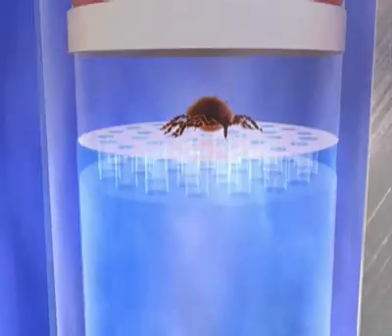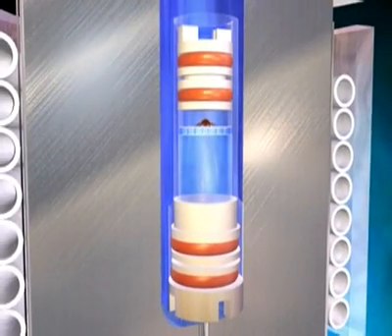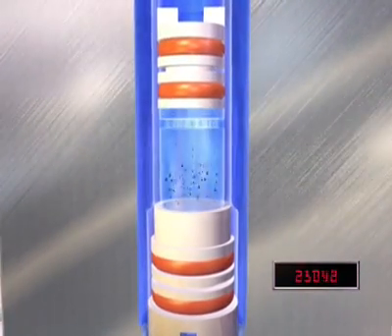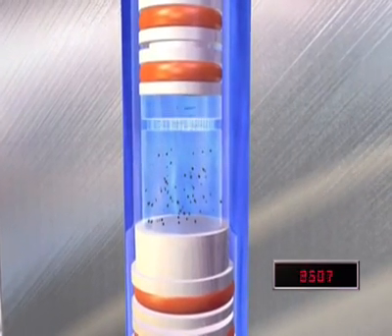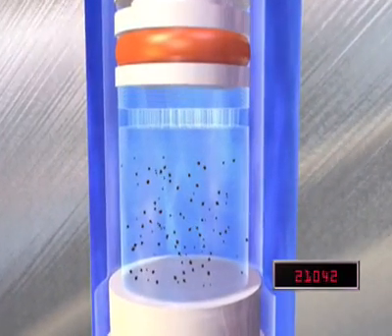Alternatively, I can choose one of many pre-programmed protocols. During the PCT process, which generally takes a couple of minutes, the tick and if present, bacterial DNA are safely and effectively extracted. When pressure is applied to the barocycler chamber fluid, it causes the RAM to move, pushing the tick from the sample chamber through small holes in the lysis disc and into the fluid retention chamber of the pulse tube.